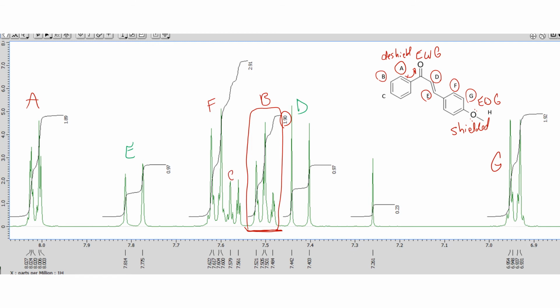So C and F, though, are so close together, they're kind of on top of each other, that they're integrating to 3. We didn't split them up. So F, C, and B are pretty close in there, and I think it tells you in the handout that you can just not come up with their chemical shift on the table. But you could go ahead and assign them if you can pick them out on your spectrum. Okay, and remember that this is the CHCl3. Okay, so that is the solved NMR of our product.